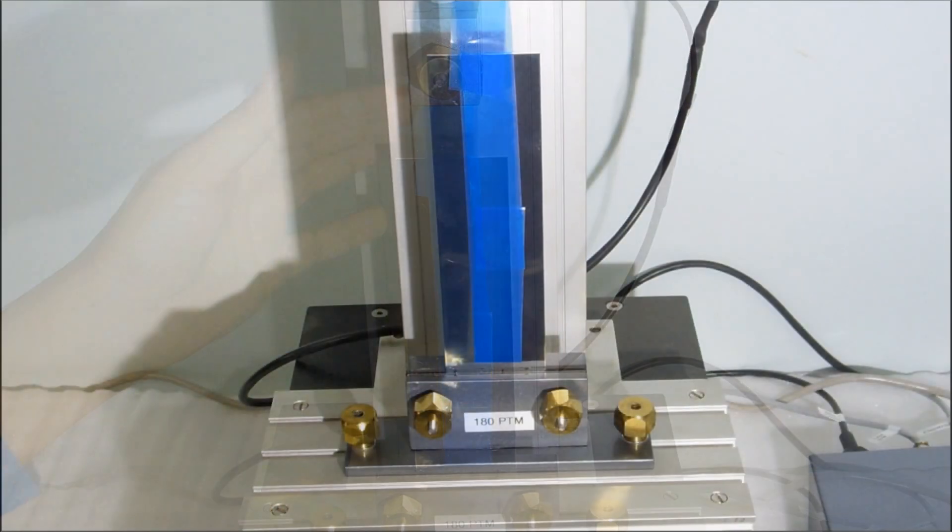If the sample is tilted then you can tilt the panel in the opposite direction to correct the tilt of the sample, such that the sample is straight during testing.